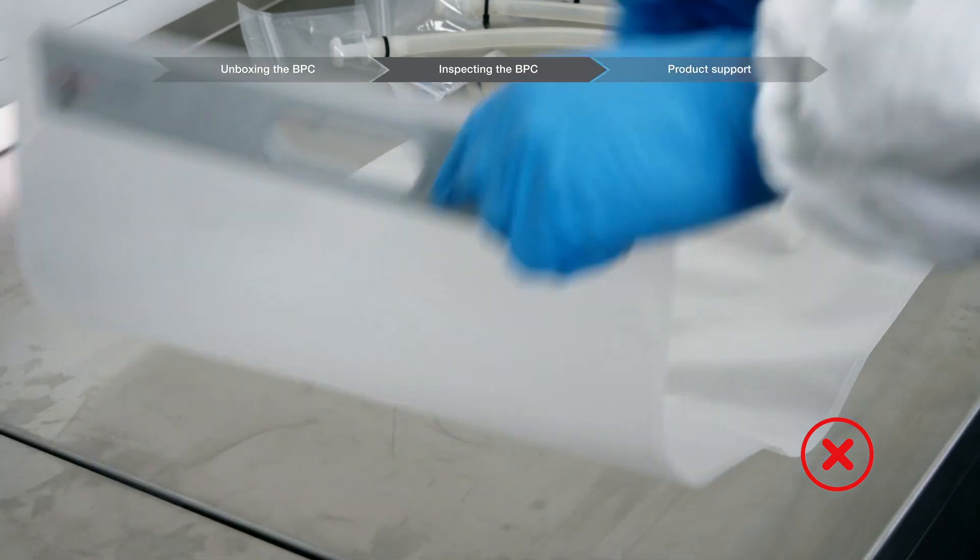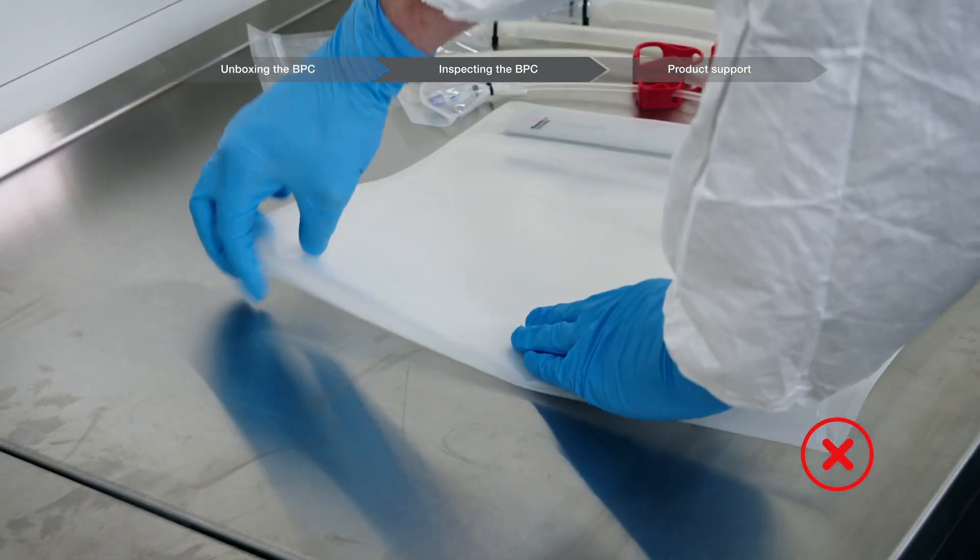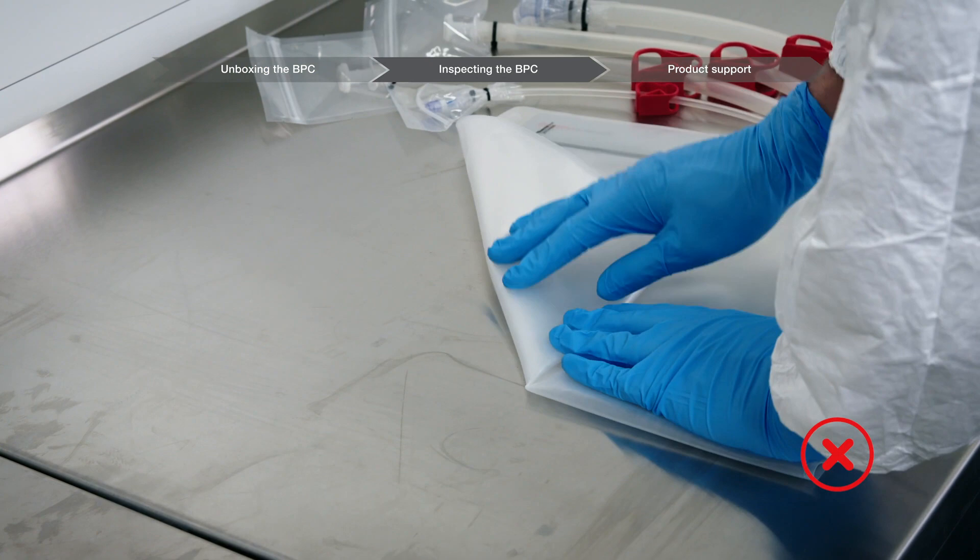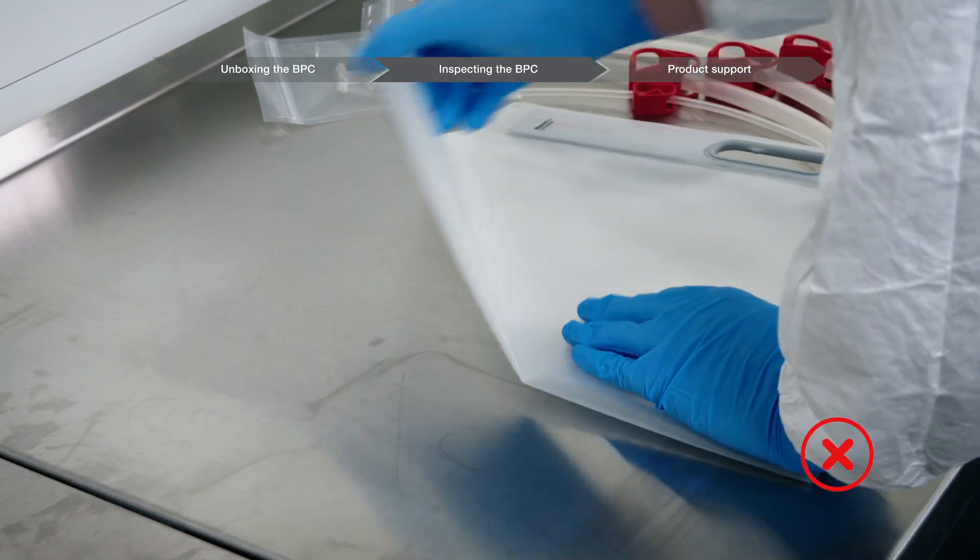Cross folding involves folding the BPC in more than one direction and is a main contributor to causing leaks in the chamber. Avoid cross folding whenever possible.